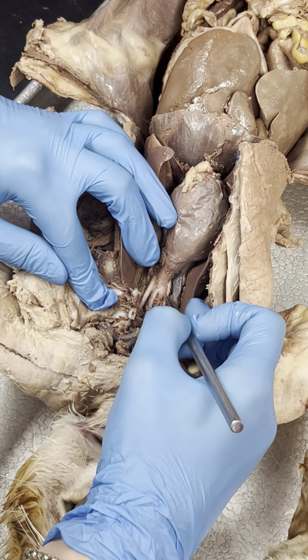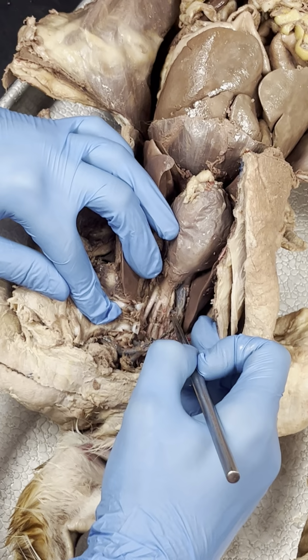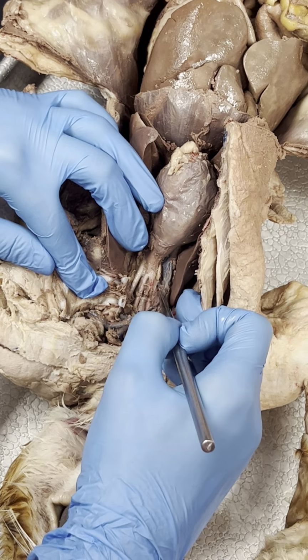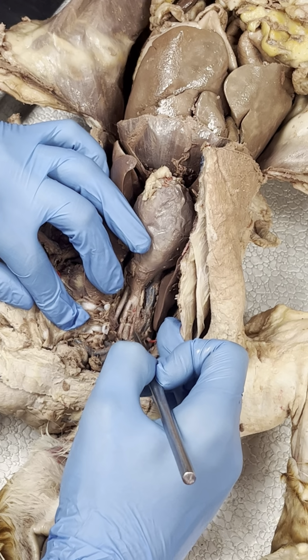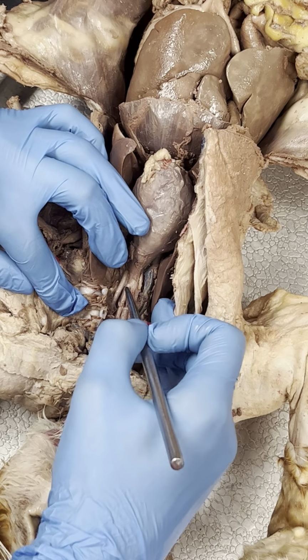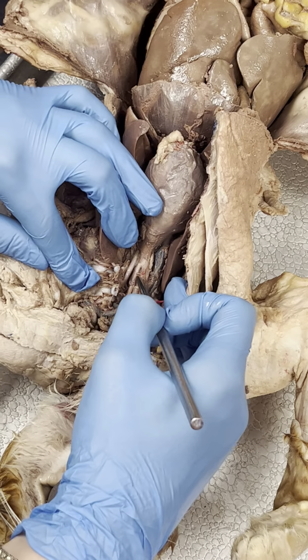And if we pull this vein to the side, you can see where it branches here. This is going to be the cat's right subclavian artery. And this branch going straight up is going to be the right common carotid. So again, for the arterial system, this is the only one that we're going to hold you to the left and right for, because there is this asymmetry here.